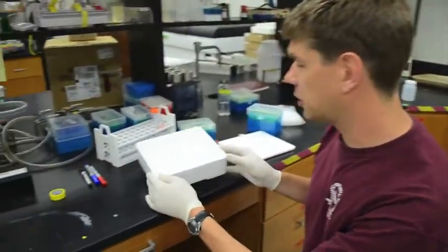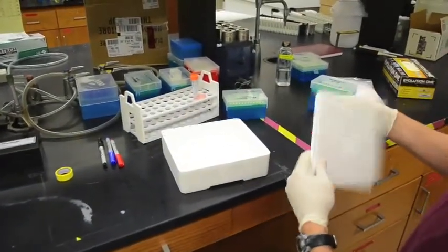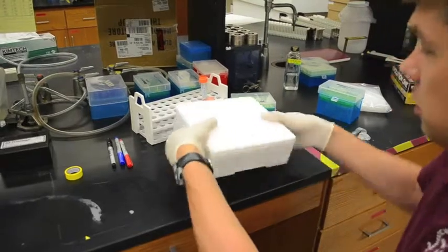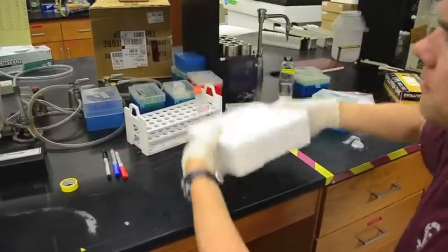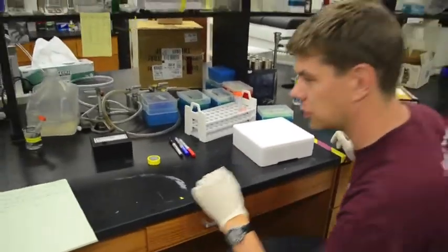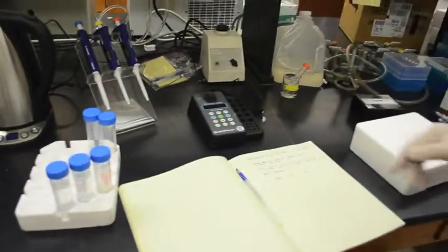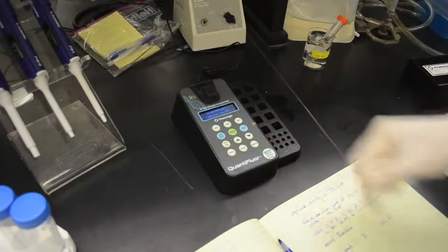So now that we've got the tops on all of the cuvettes that we're going to be using, we want to mix them up. All the chemicals that we've added should be nice and well mixed, and the easy way to do that is we just put the top on, hold it on, and turn it upside down a couple of times. So now that they're nice and well mixed up, we are ready to measure the fluorescence. The way we do that is with this fluorimeter, which is just about exactly the same as you all have. Real easy to use. All we have to do is turn it on.